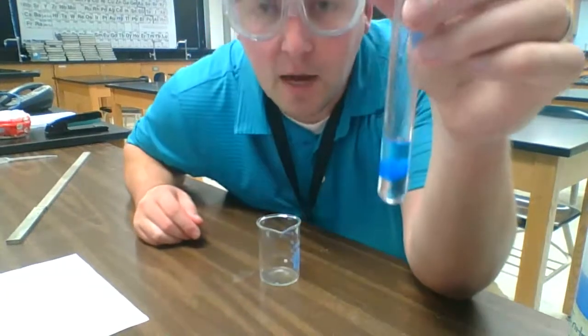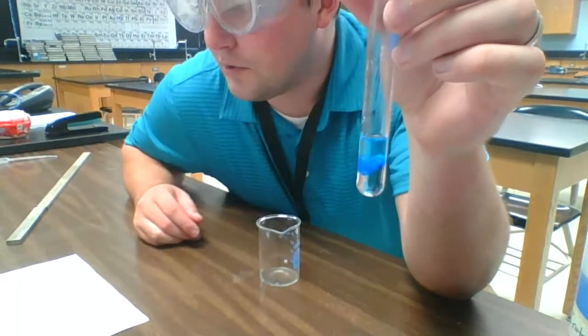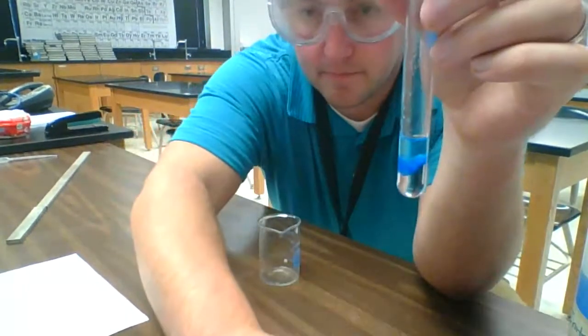So anyways, this part involves us taking these 2 liquids and forming this solid out of them. So this is just the first half of part 5. I'm going to pause the video as I set up the second half of part 5.